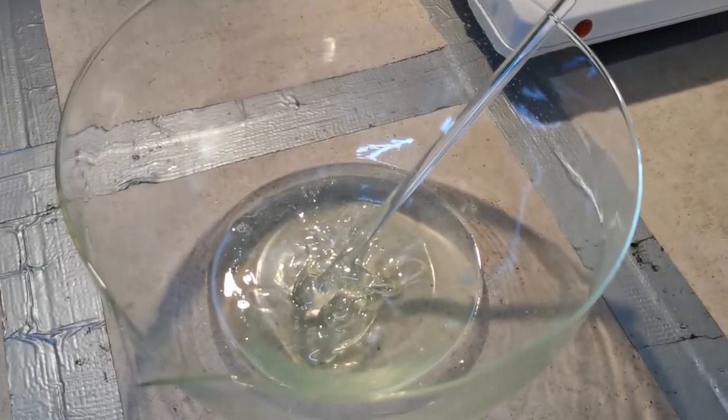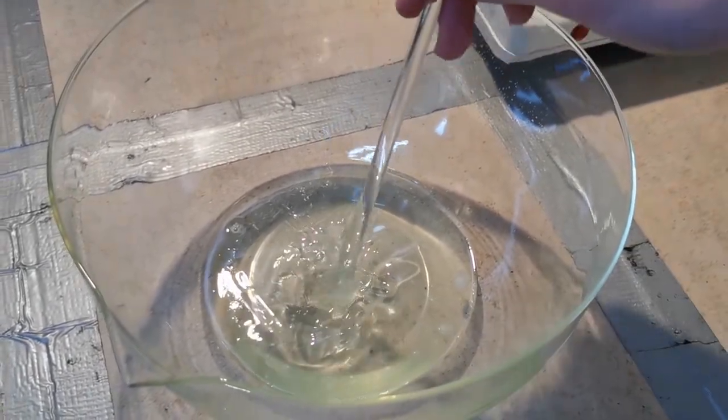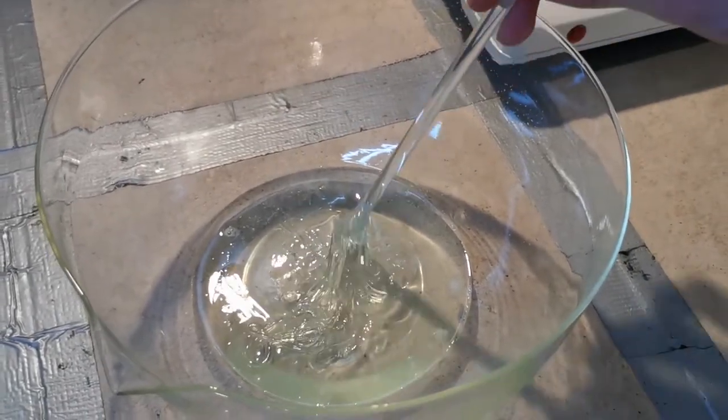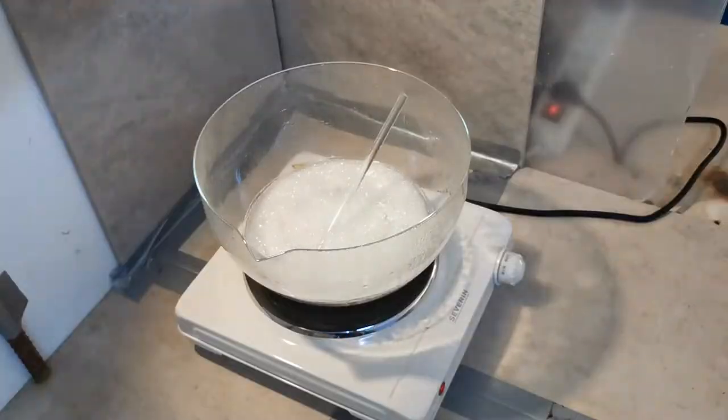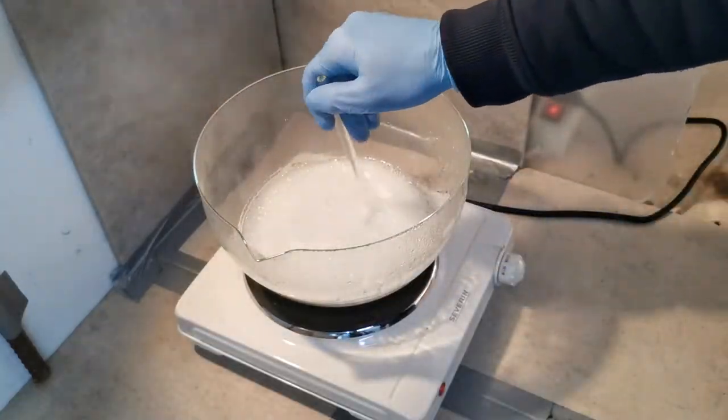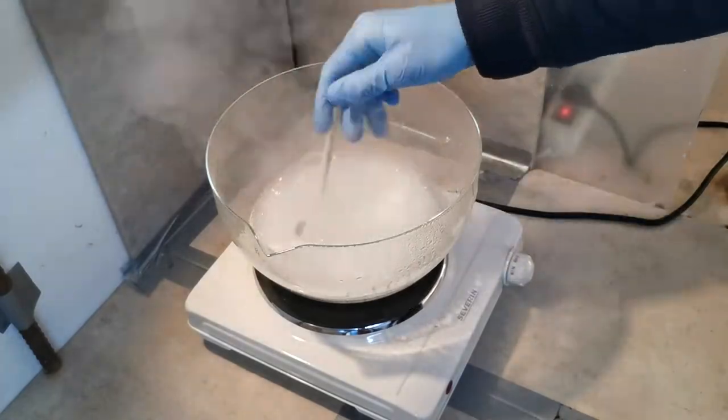On cooling however, it all turned into some weird syrup liquid, which just didn't want to grow any crystals. Even with lots of scraping the walls and leaving it out overnight. The next day I chose to just get rid of the water and try make the anhydride.